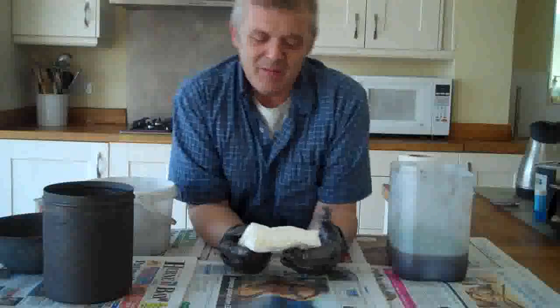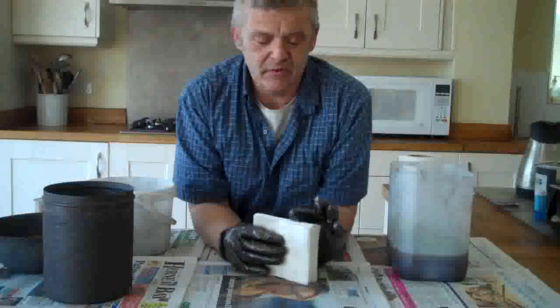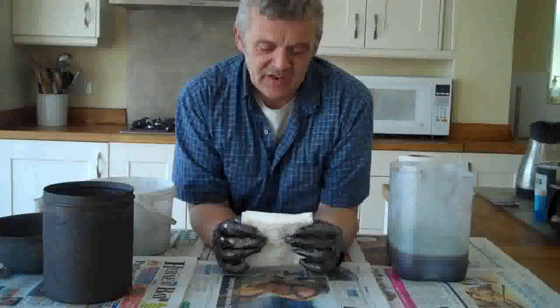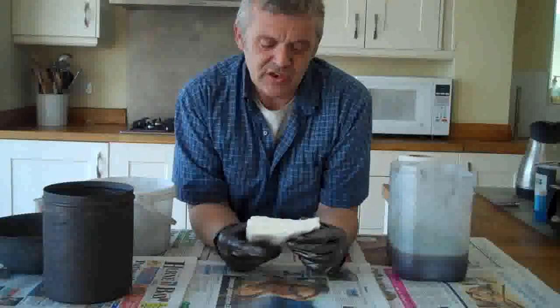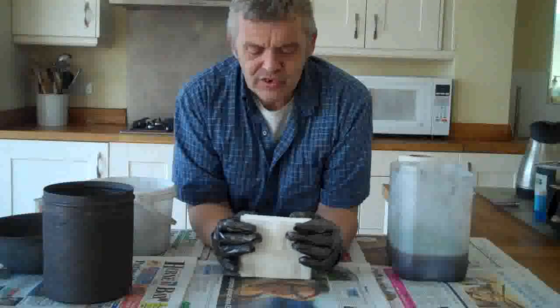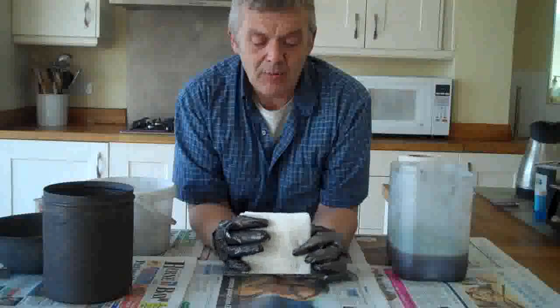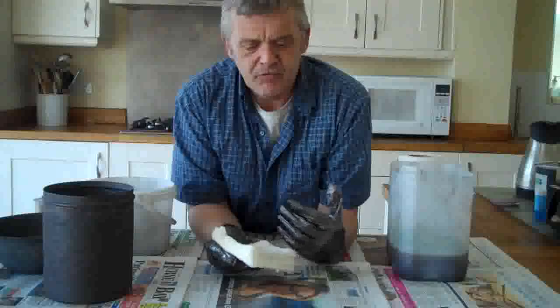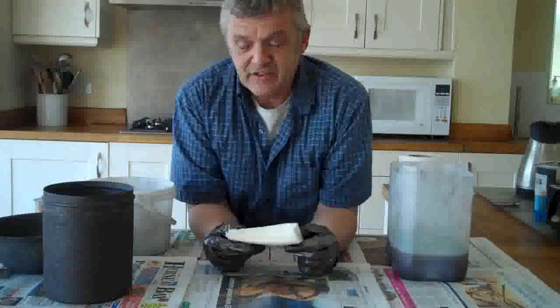I got myself a batch of toilet paper and I've not done this before. Normally I go through these things quite a few times and make sure I've got most of the wrinkles out before I do a video on them. But this one I've done nothing on at all, which is kind of interesting and exciting — I don't really know if this is going to work or not. My plan is to carbonize this and then graphitize it using the iron salt. I'll dip it in the iron salt to make sure it's soaked and then gently carbonize it.